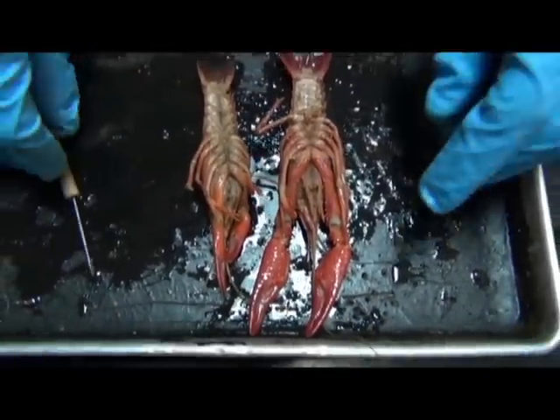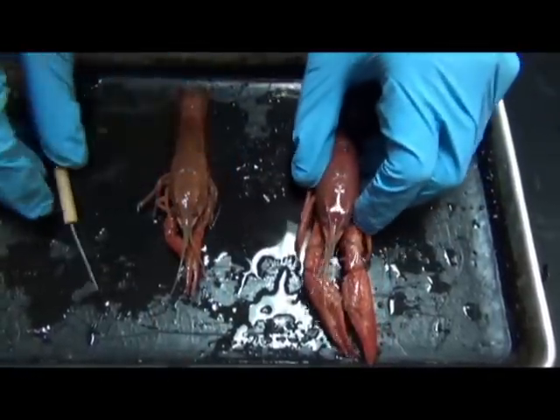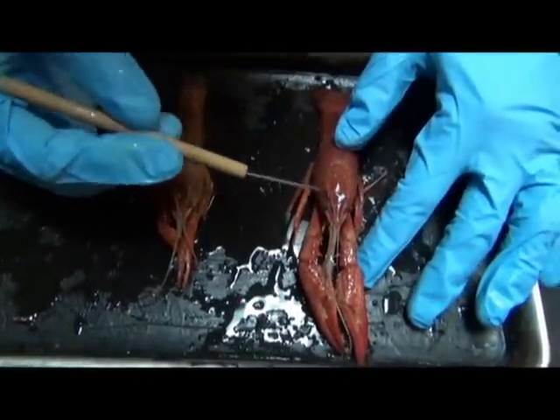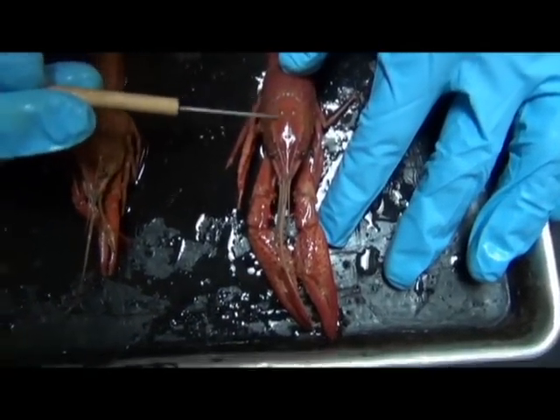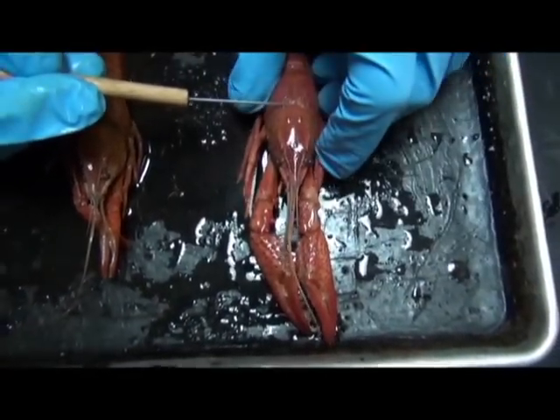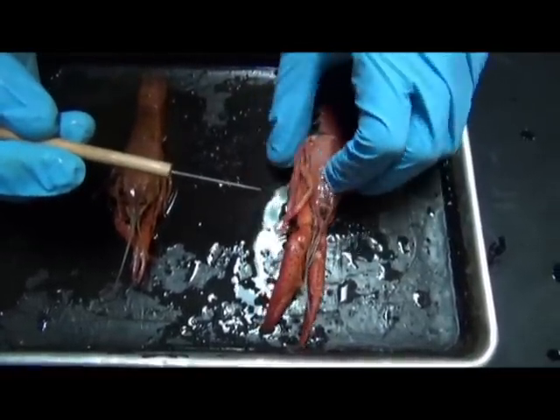Okay. Other things to mention about this animal, which are pretty cool, is that if we were to look on the inside of the animal, behind the eyes, you'd have the stomach. The stomach would be sort of inside here. Okay. So the stomach is located really behind the eyes and the face.